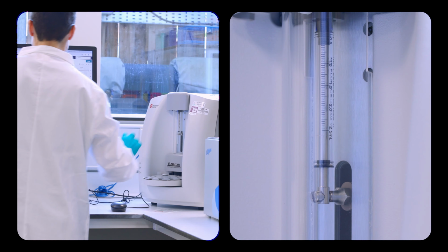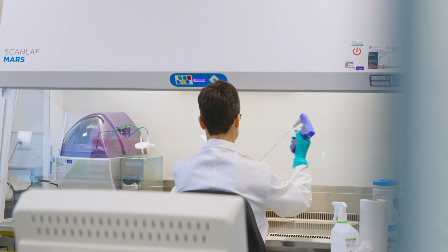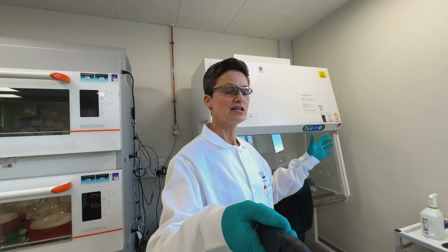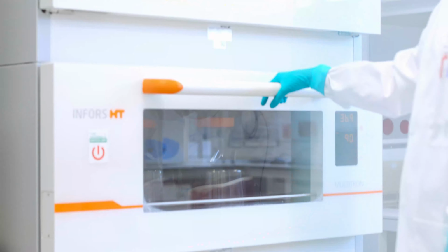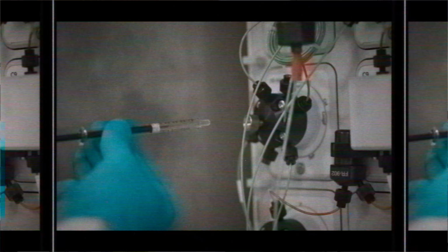I'll do a cell count on the cells to see if they're healthy. If they are, in my biological safety cabinet, I'll add the DNA, which Chady and I originally designed, and add that into the cells. Leave it a couple of days for the host cell machinery to make the protein. After 2 days or so, harvest the cells and then take those cells forward to the purification process.